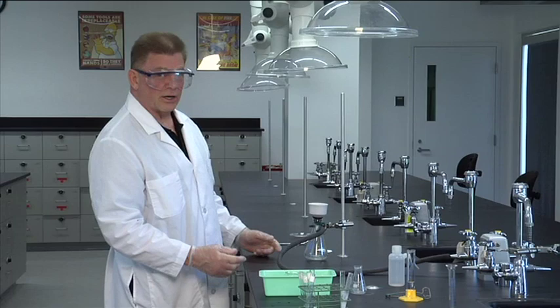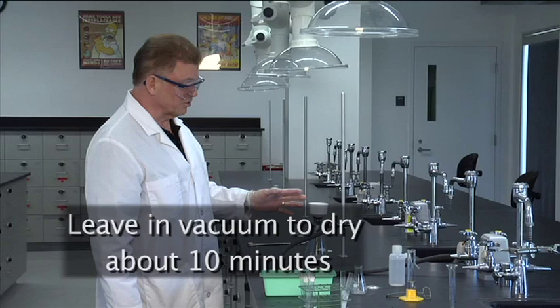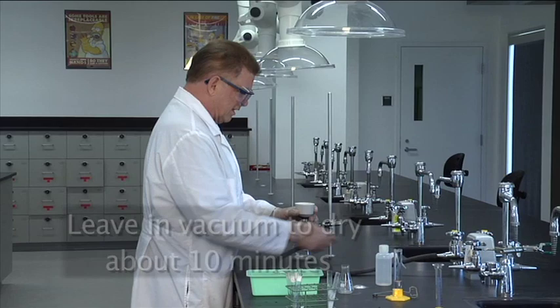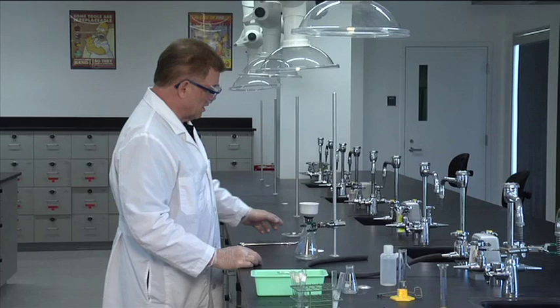You know, I think in the interest of time for this video, I'm just going to go ahead and we're going to pretend that this stuff is dry because I want to show you what we're going to do with the material next. So pretend it's been drying for ten minutes. We turn off the vacuum. I can disconnect this now. Now the flask is probably not going to fall on the floor.